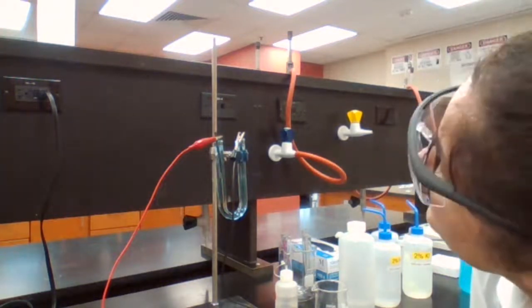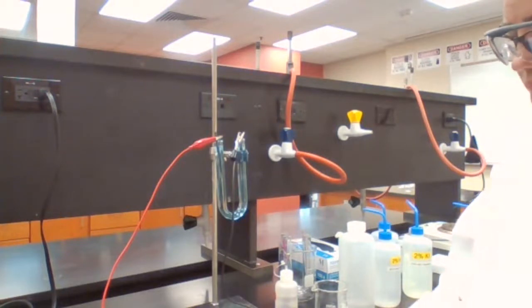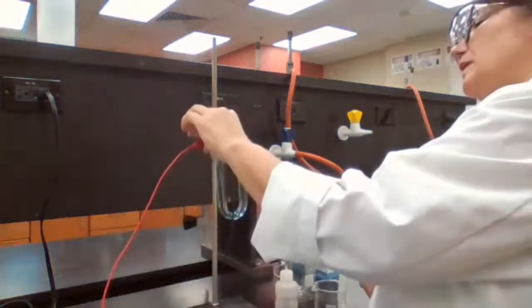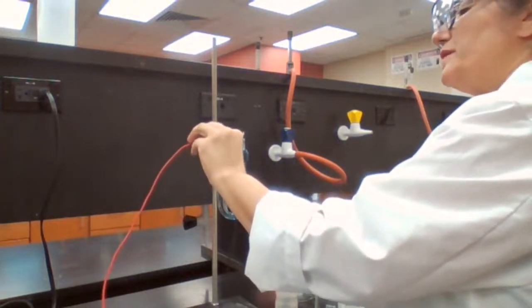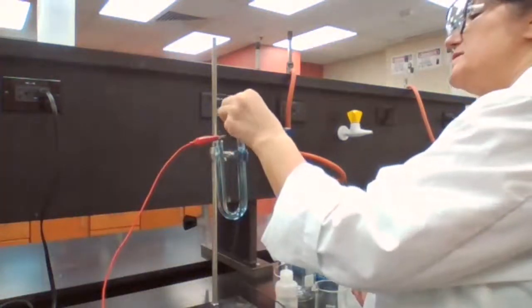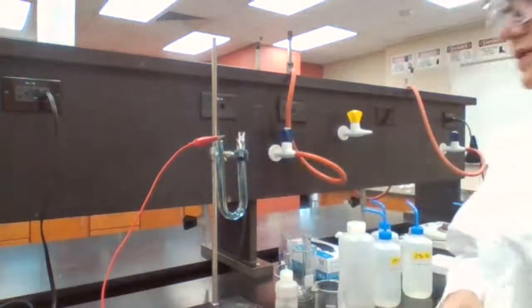Okay. I don't see the pink color. I'm going to give some more time because I have to wait until something happens so I can show it to you.